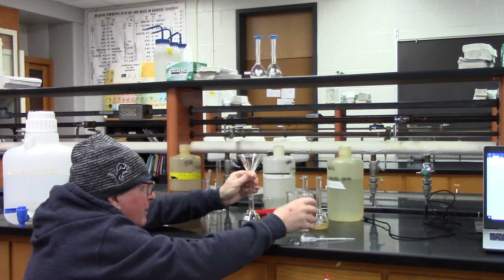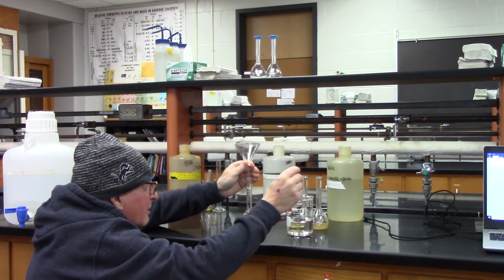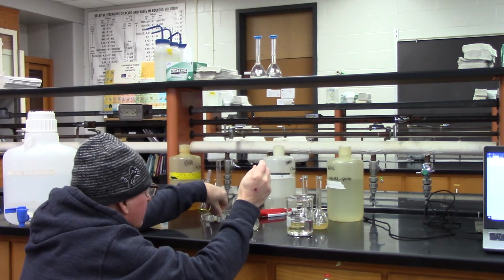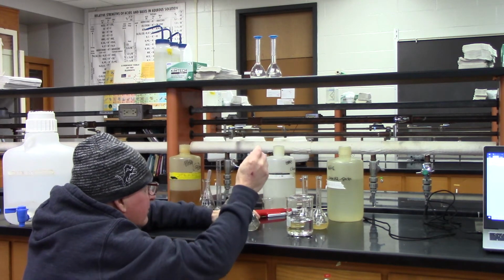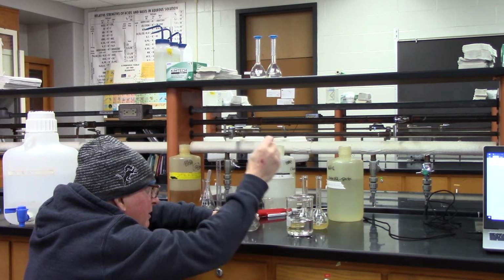And you know, one thing about chemistry is it takes time, right? You have to be patient with making your solutions.